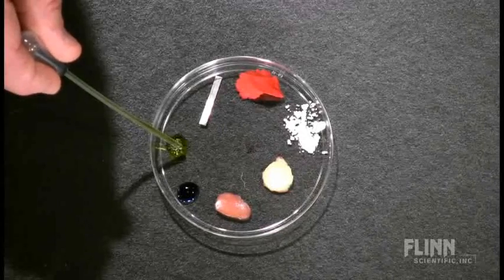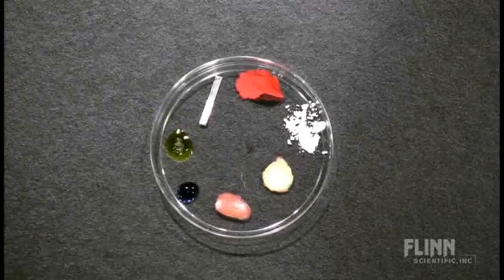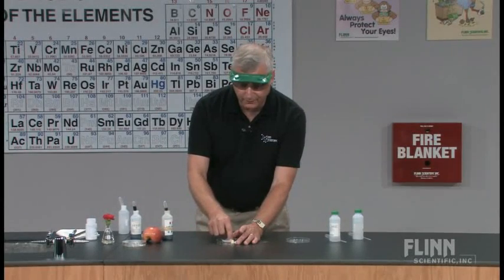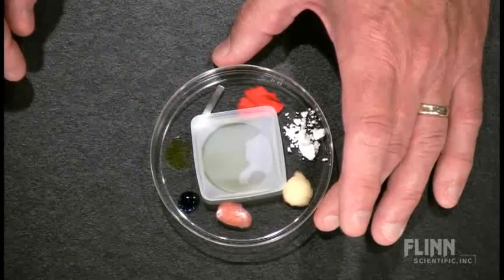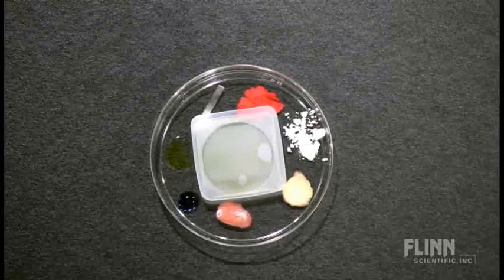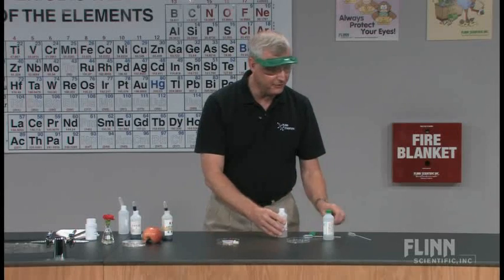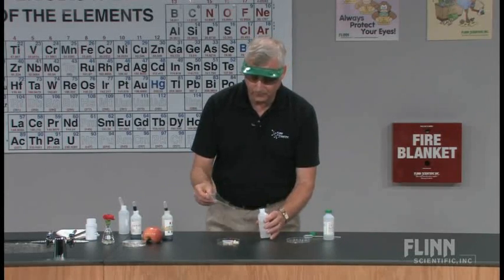We want to be careful that we don't let those liquids run around in there too much. To create the acid rain, we're going to take a small weighing boat and place the weighing boat into the center. With the weighing boat, what we're going to do is place about 10 drops of a dilute sodium sulfite solution in there.